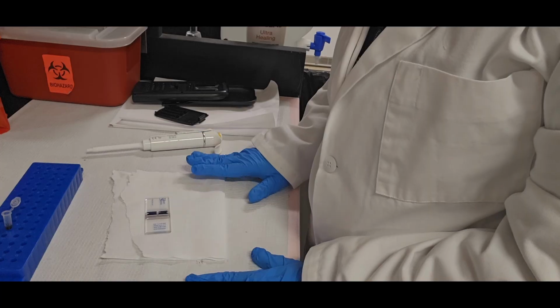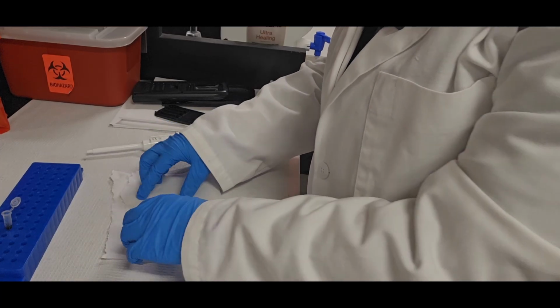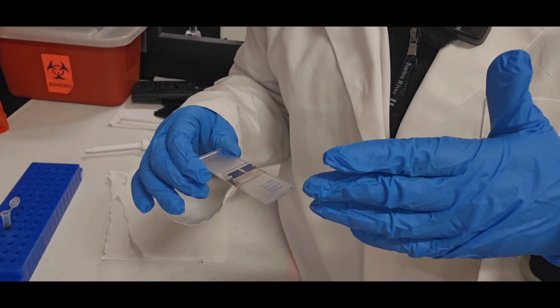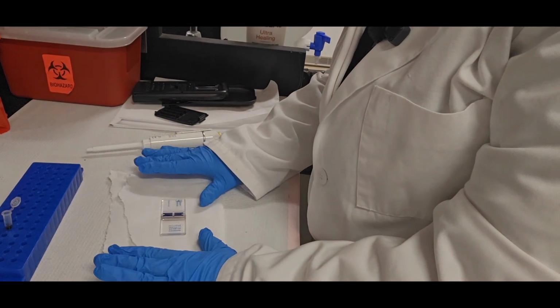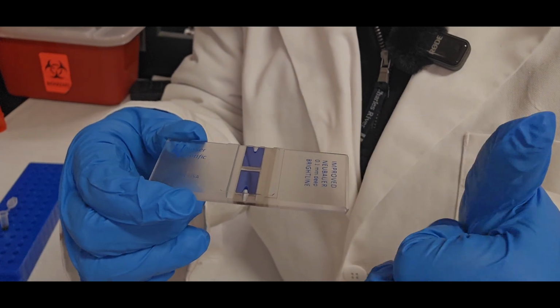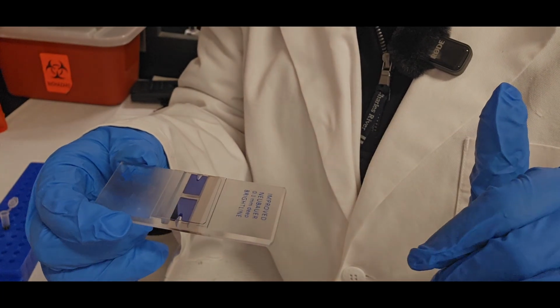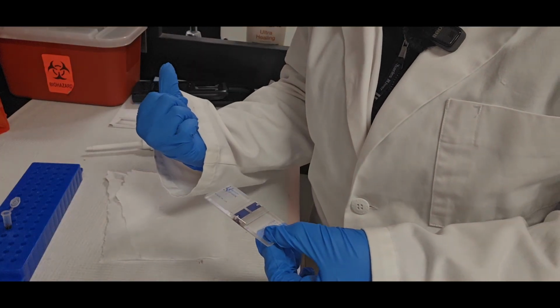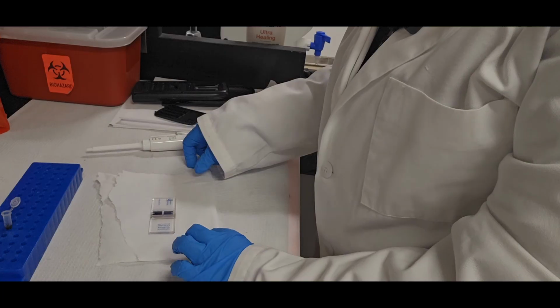For experiment purposes, I always run both sides of the hemocytometer. So technically you could do a cell count off one side, but for good practice, you should be counting both sides and then averaging both sides to get a more accurate cell count. Now, I've been doing this for a while, so I was able to pipette without any bubbles appearing in the squares. If any bubbles appeared, you would have to redo that, which is why we have the second hemocytometer. You could just go over there and retry on that other one until you get two sides that aren't compromised.